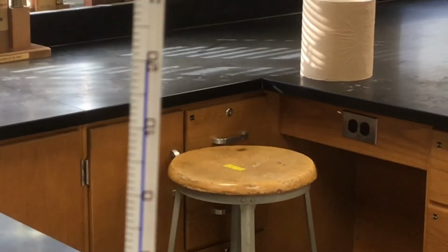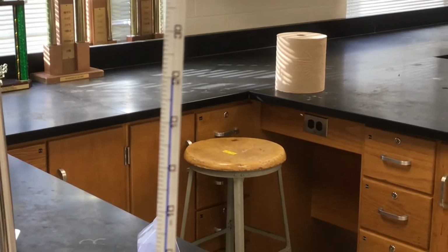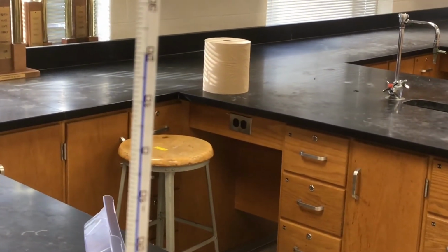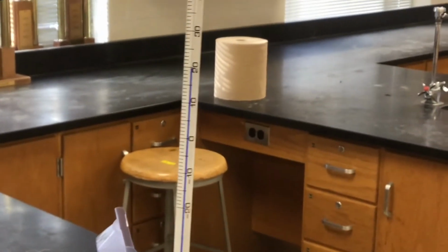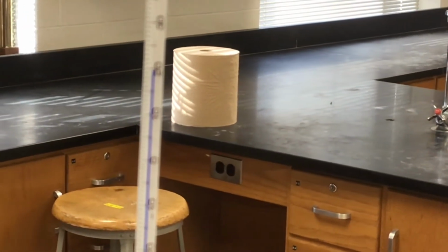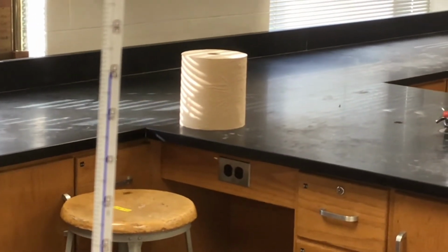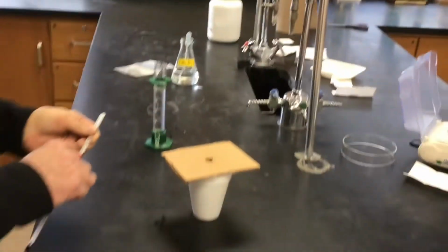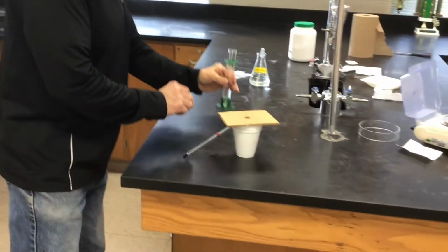But look at the graduations on this. We're going to have to get the best measurement we can out of that thermometer. And if you would focus, I'd be so happy. There we go. Notice it's going up in 1 degree increments. That's important. Okay, so we'll get that initial temperature of the acid when we're ready to start.